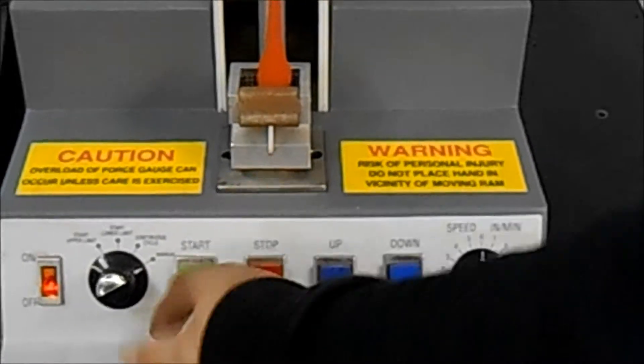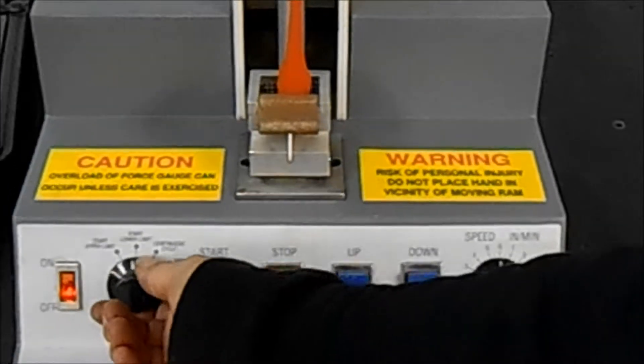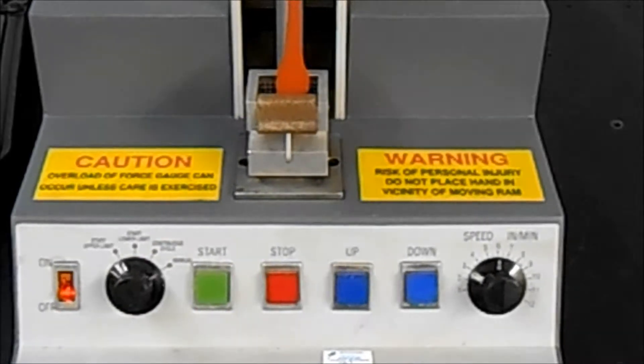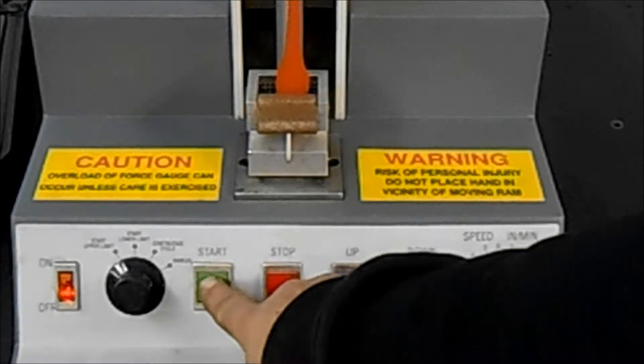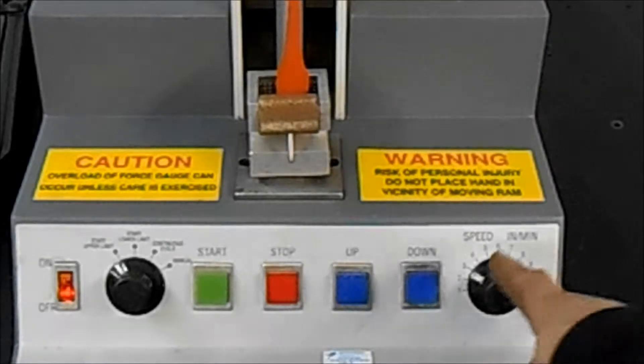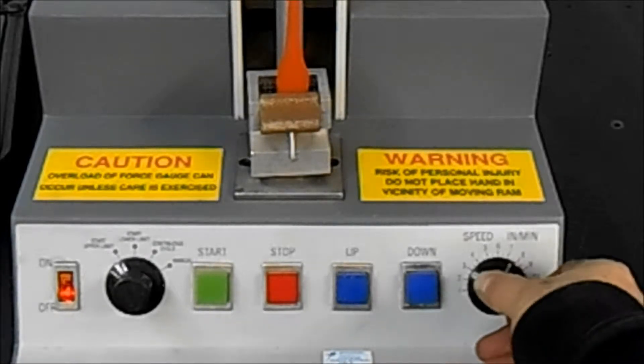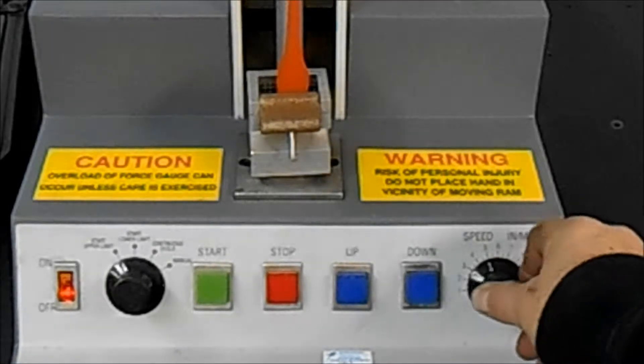It's got several cycles here on the dial and we will do a start upper limit. I don't think it will reach the upper limit. We'll find out. So that's at six inches a minute and we can take it up to 12 and we can see that the speed control functions perfectly.